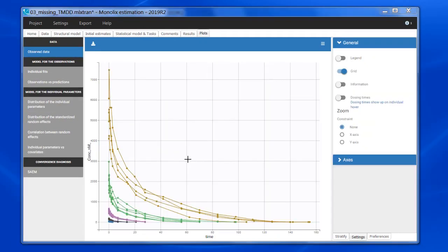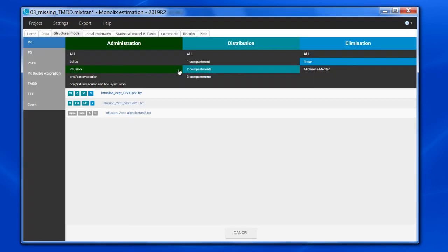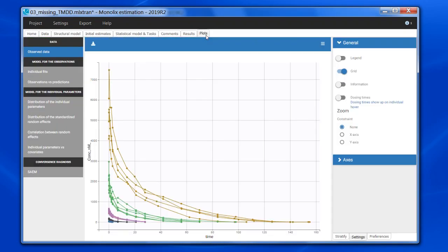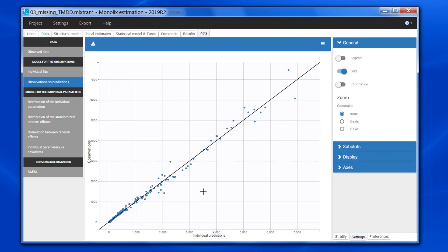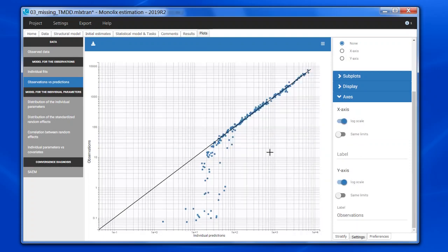In the third example, it is a dataset for a monoclonal antibody with several doses. I have tried to fit a two-compartment model, so a simple linear model. If I look at the Obs vs. Pred plot, in linear-linear scale, it looks okay. But if I change to log-log scale, I can see a deviation for the small concentrations. This time, the prediction is larger than the observation. This is quite typical of a non-linear elimination not properly accounted for in the model.